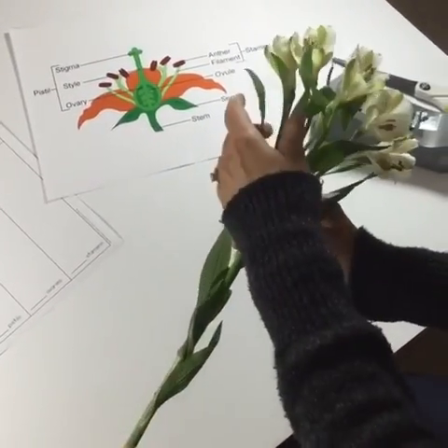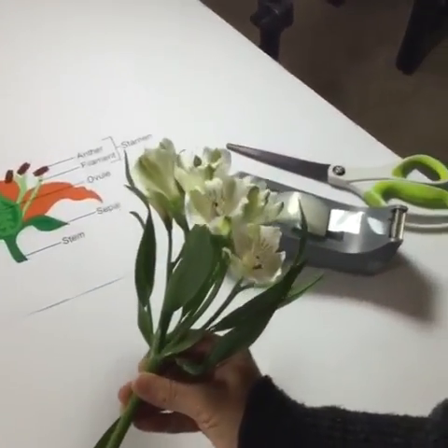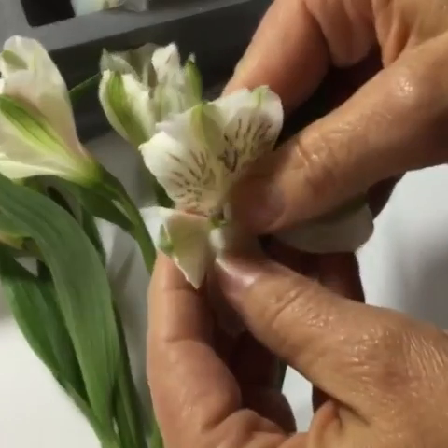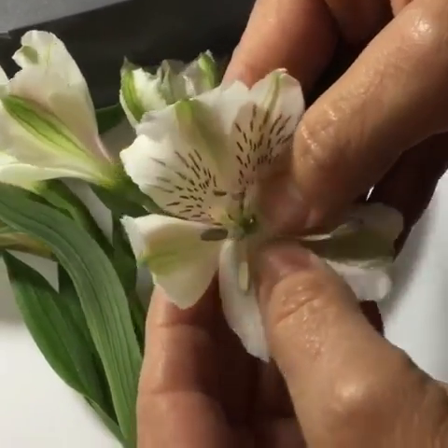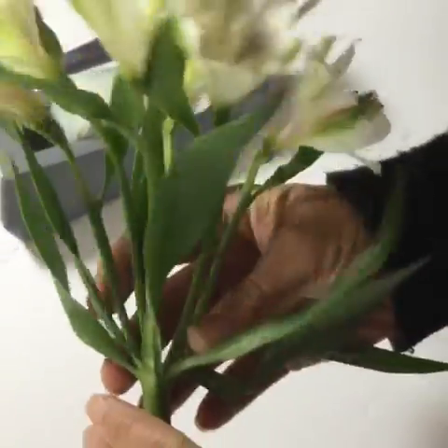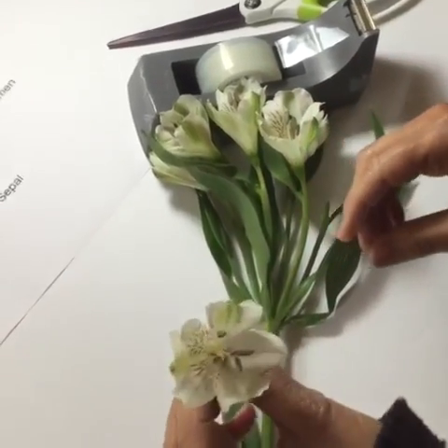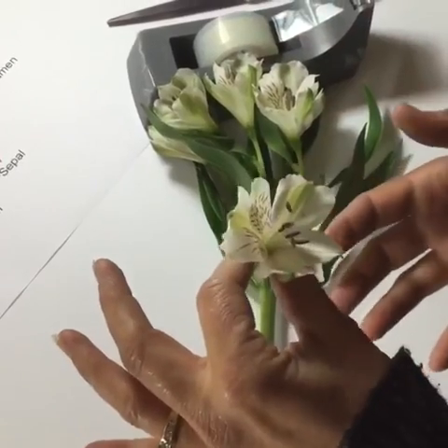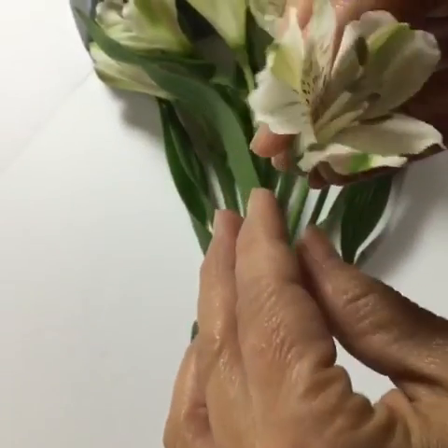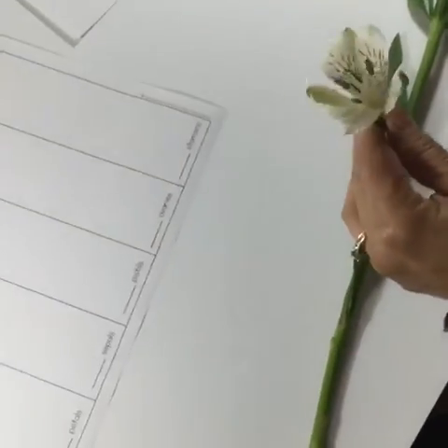We use the alstroemeria, the Peruvian lily, for this dissection, for several reasons. It's an excellent flower for dissection — it has all the parts, and the male and female parts are easily identifiable. The female part is the one without the purple heads, and the male parts have the pollen. It's also very inexpensive — an entire bundle could be used to teach two classes, and should be four or five dollars for the whole bouquet. They're pretty readily available all year round, often used as filler flowers and findable at the grocery store.